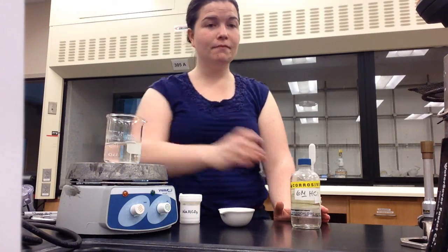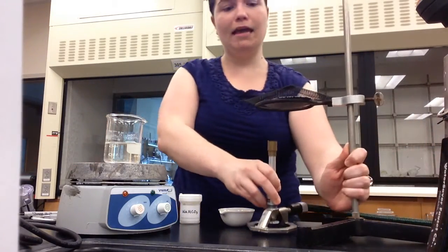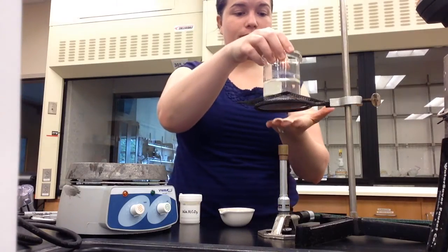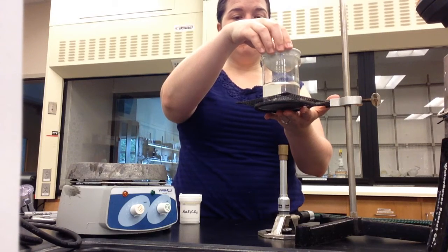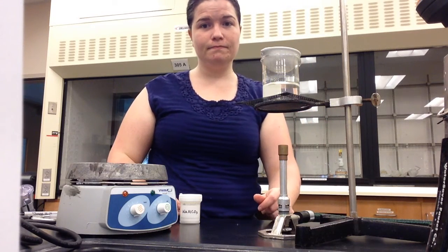The second part of this experiment involves gently boiling the solution in the evaporating dish to remove the water and recover solid sodium chloride. Place the evaporating dish containing the mixture over a 250 milliliter beaker containing approximately 150 milliliters of gently boiling water. You can obtain gently boiling water by using a hot plate. That's one option. Or you can set up a ring stand and the Bunsen burner to boil the water instead. Either way, you should place your evaporating dish on top of the beaker containing the gently boiling water.